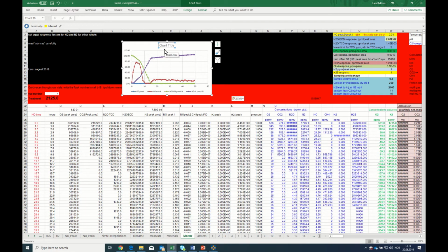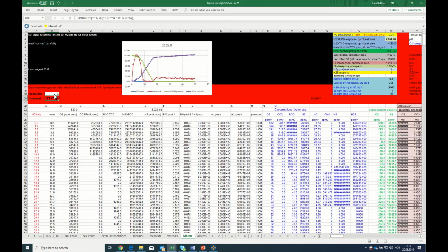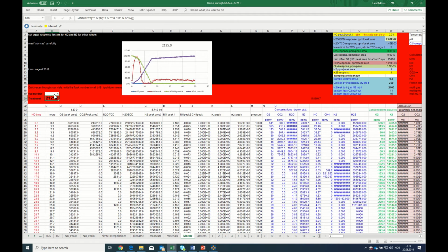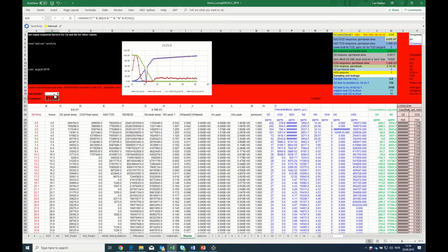You can even make sure that you get the title if you click on the chart title and write equals, and then you mark this square and you get the title. Now that's not so interesting in this experiment because they all have the same title, but if you have different titles, you will see in the window the treatment that you're looking at. And now you can go through the different treatments. Two looks slightly different, but not dramatically different. Three, four, and five, and six. Now in six there is a problem, and we will deal with that in a moment.